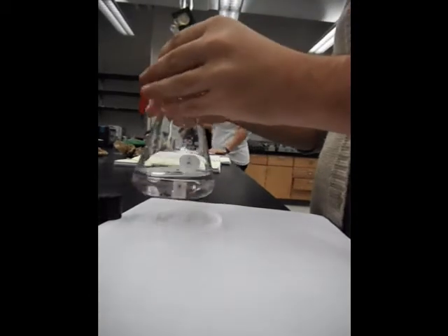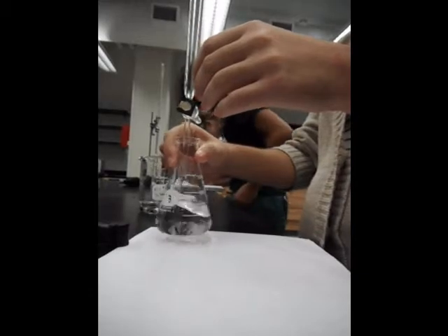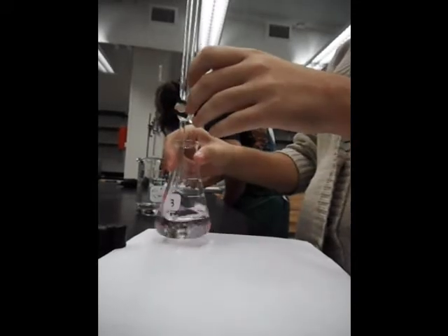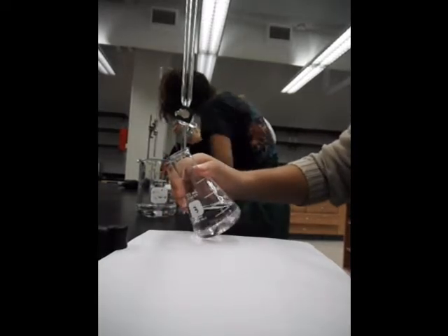The same thing goes for cleaning the flask, except this time you use 3 times tap water and 3 times deionized water. And here our endpoint has been reached.